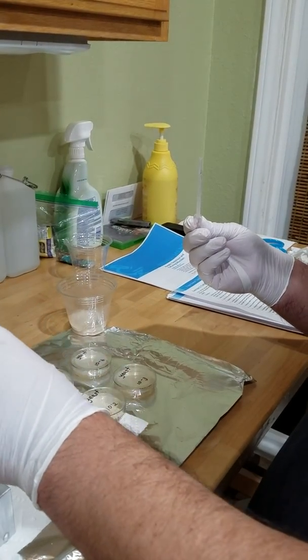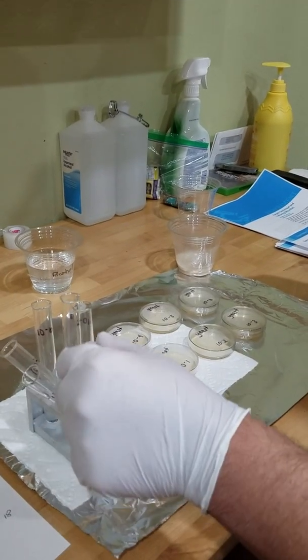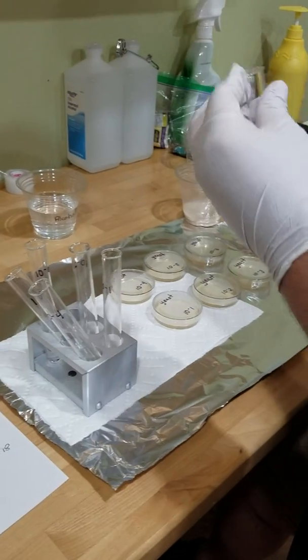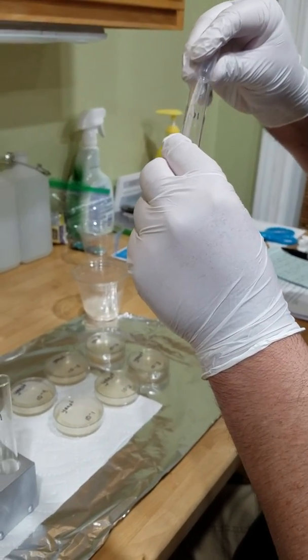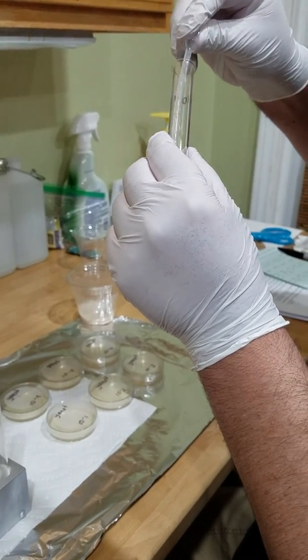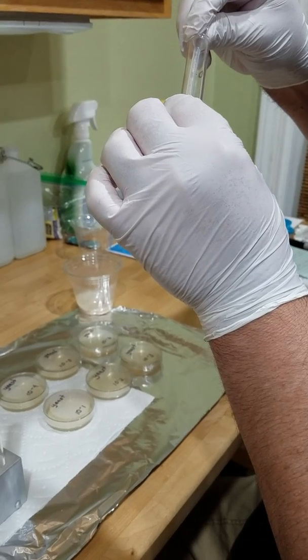Let's put you down. Now let's try not to make a huge mess here. I apologize, doing the best I can here. So we're going to put this into 3. Now let's get 1/4 ml from this one.